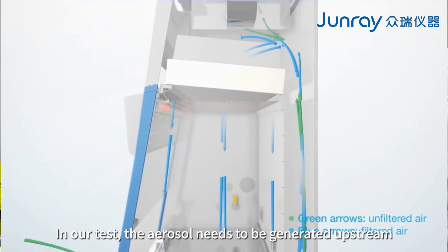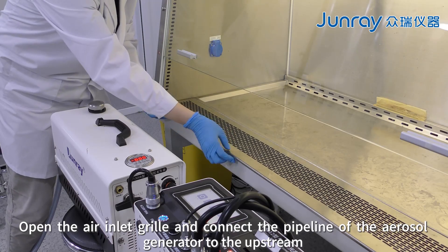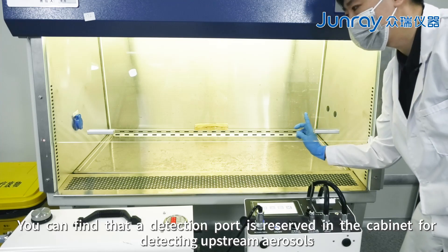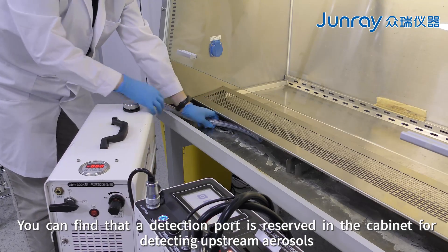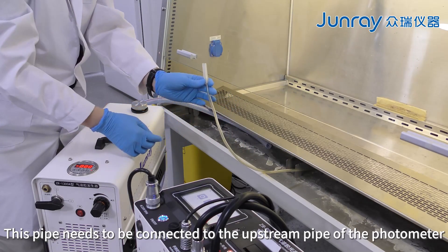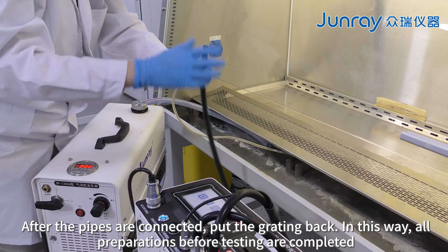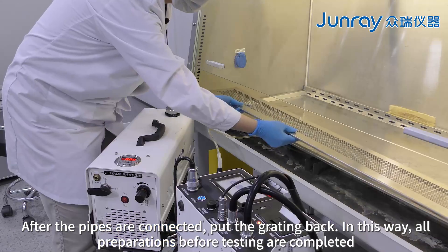In our test, the aerosol needs to be generated upstream. Open the inlet grill and connect the pipeline of the aerosol generator to the upstream. You can find that a detection port is reserved in the cabinet for detecting upstream aerosols. This port needs to be connected to the upstream pipe of the photometer. After the pipes are connected, put the grating back. In this way, all preparations before testing are completed.